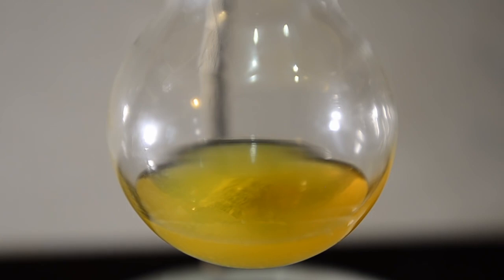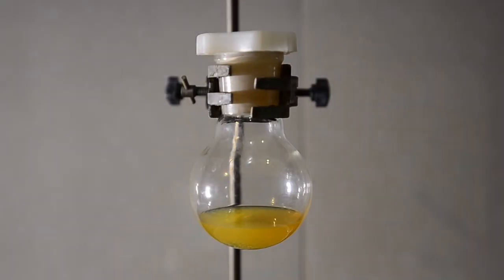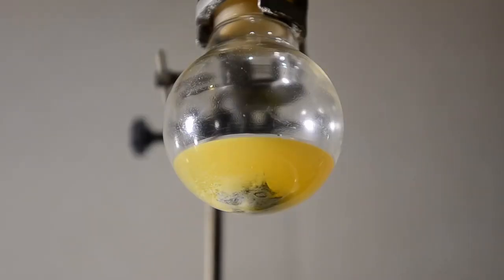Just for your information, we didn't use a reflux condenser on the flask, but we used a stopper very lightly inserted in order to keep air and moisture out as much as possible.